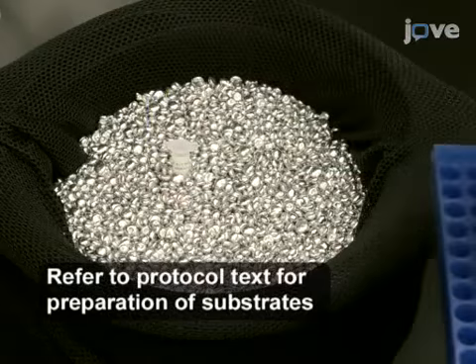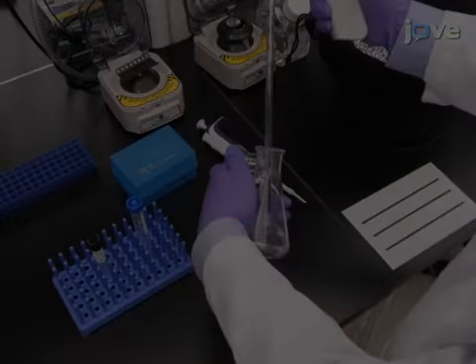Thaw the heat-killed bacterial substrate on ice. Resuspend the bacterial substrate.